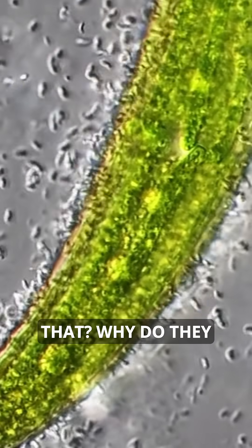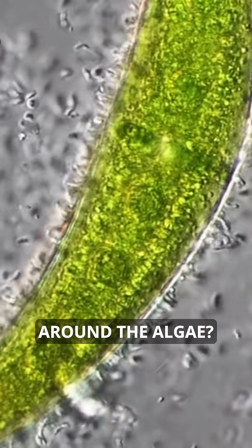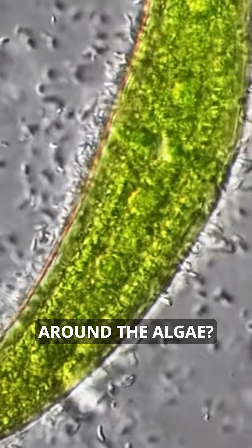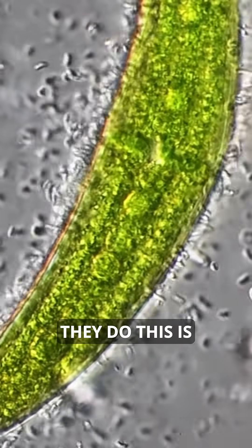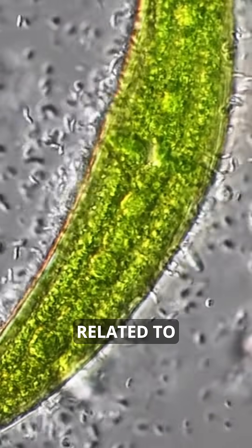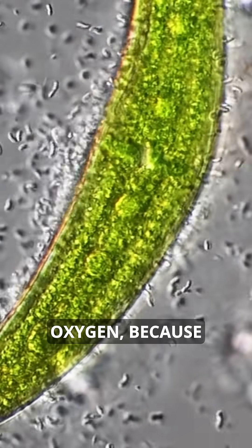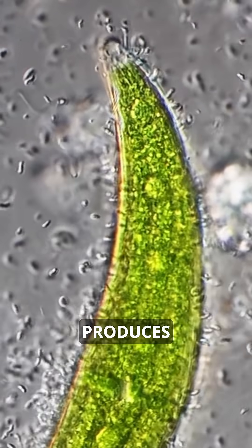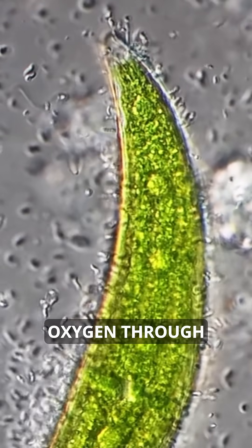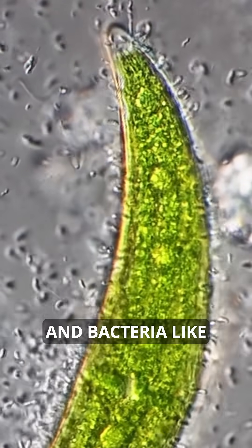But why is that? Why do they collect around the algae? The reason they do this is most likely related to oxygen, because Closterium produces oxygen through photosynthesis and bacteria like these need quite a bit of oxygen.